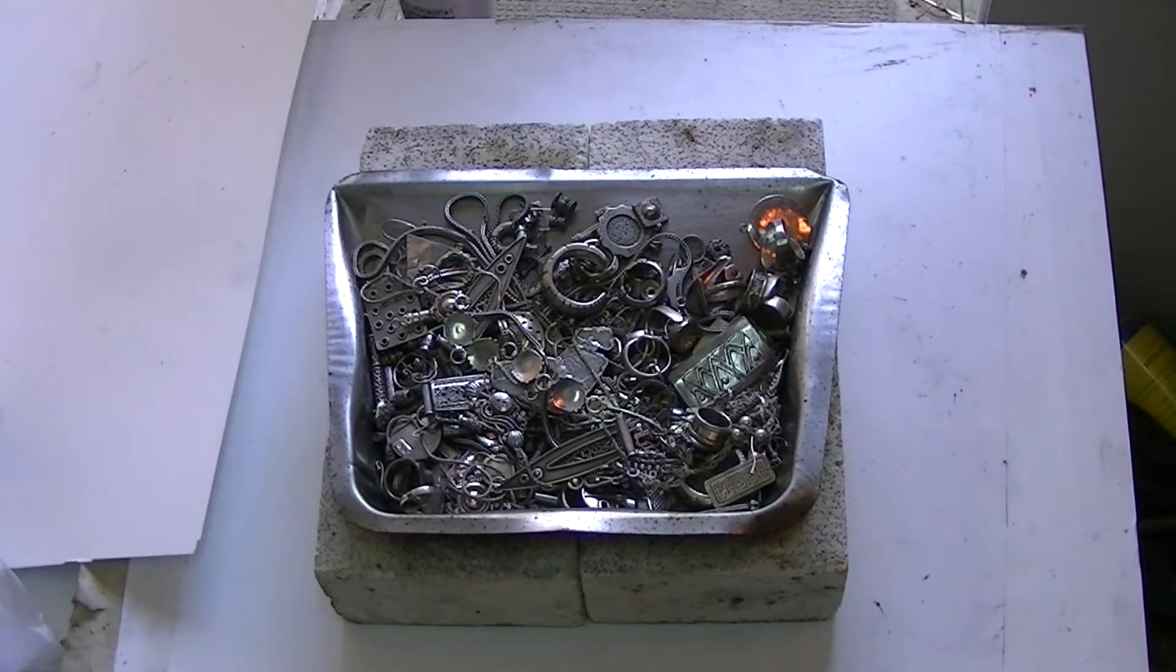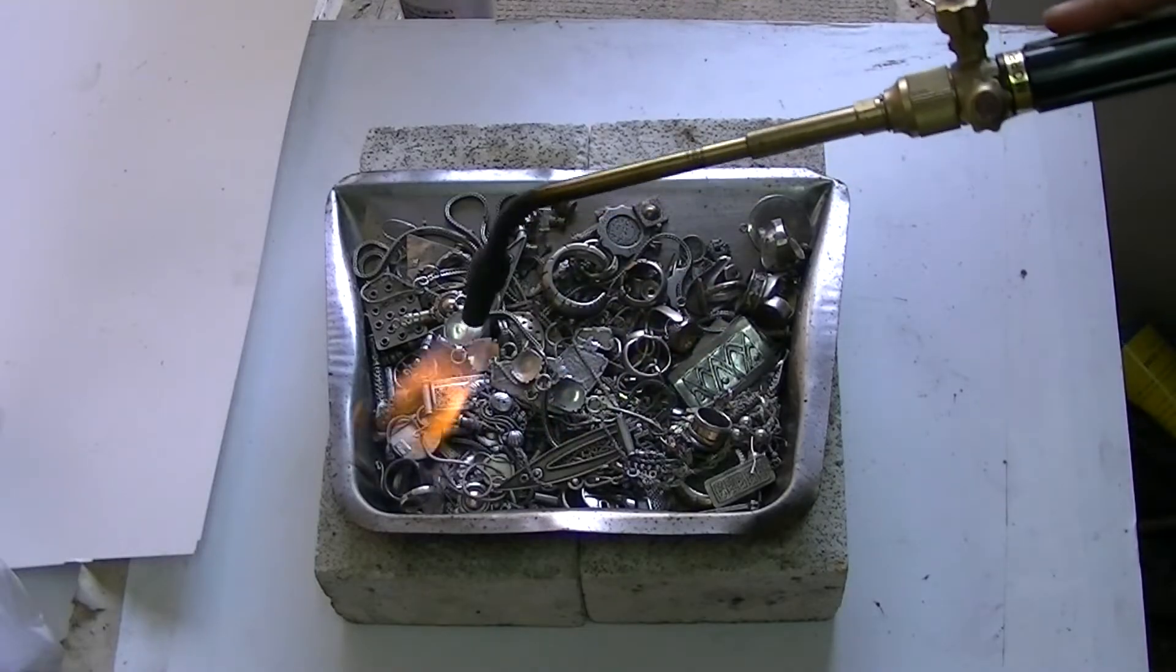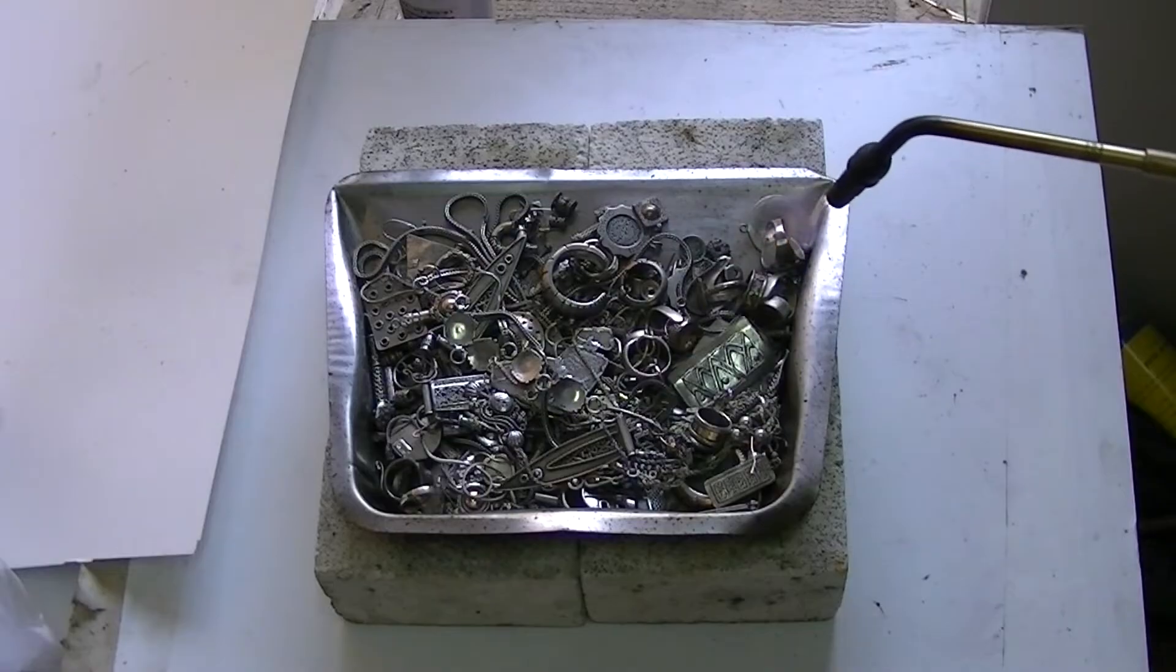The first step in preparing the scrap is to incinerate it, preferably in a stainless steel pan. Remember, good ventilation is needed here as some organic residues may catch fire and get real smoky.